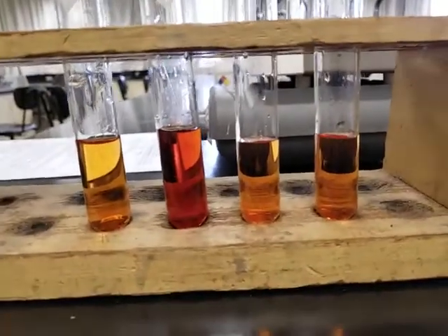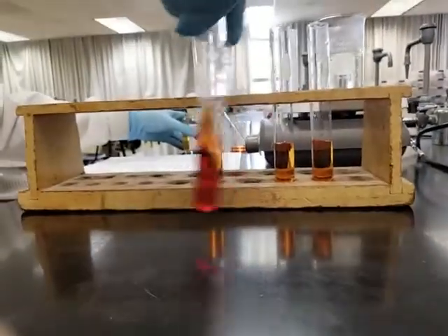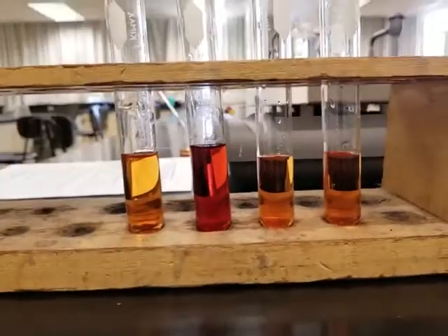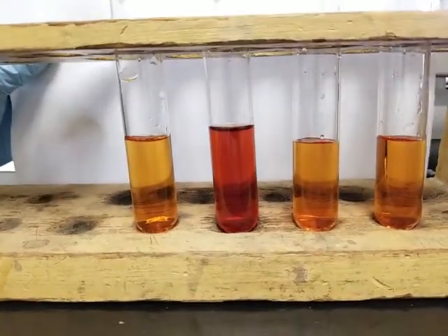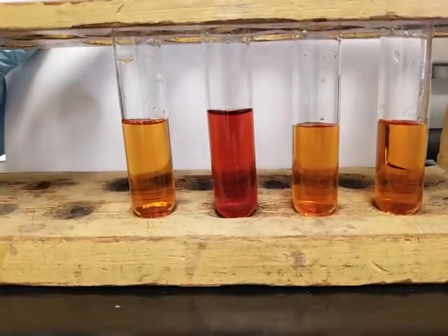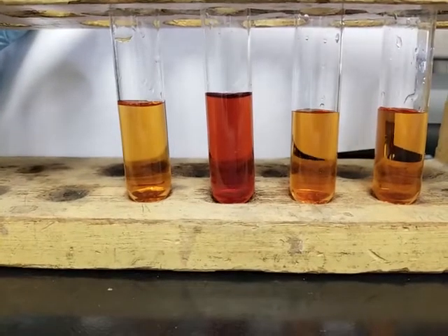You're going to compare it with your first test tube. Let's give it a good swirl. Let's shake it a bit, and you make the observations. I'm not sure how well the video turns out to be, but there's probably some difference. This is test tube 2 compared to your control. Do you see any changes? If yes, write it down. What did it change from and what did it change to? Okay, that's test tube 2.